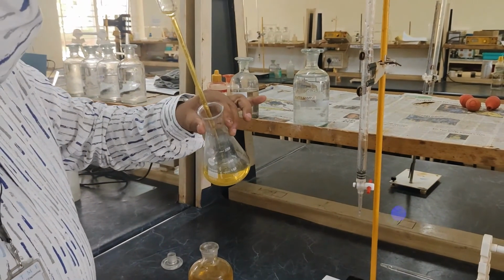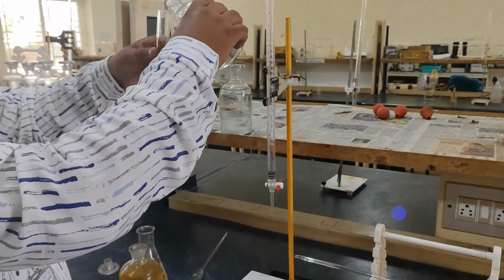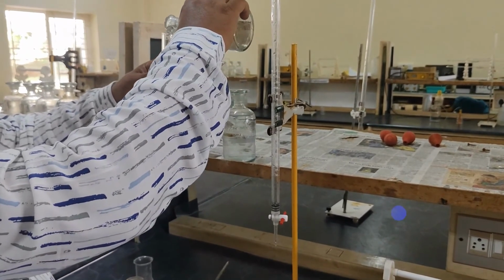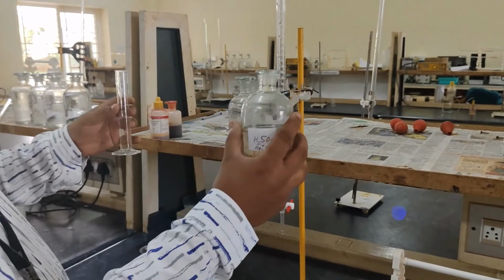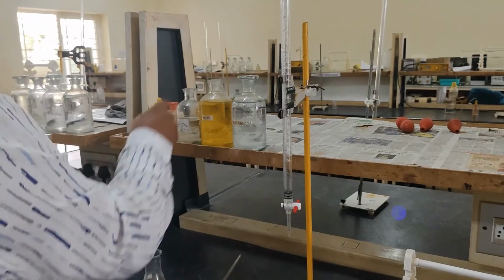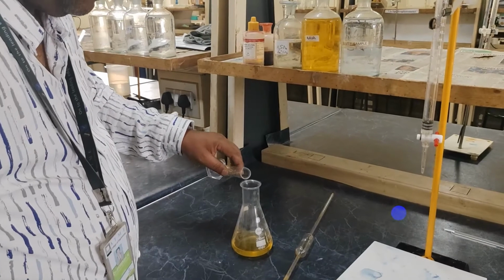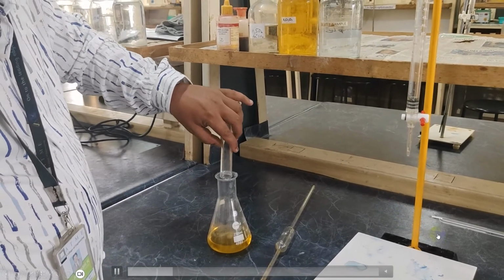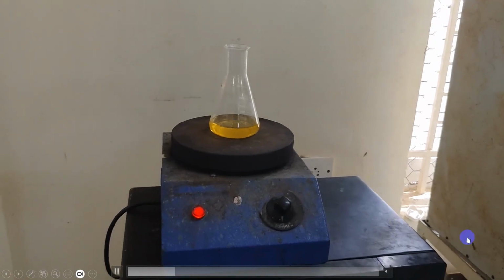If required, you have to take 50 ml of the dichromate solution, depending on the organic compound present. Later, you have to add sulfuric acid and the catalyst silver sulfate. Here we have taken the silver sulfate solution, which is dissolved in sulfuric acid. Around 10 to 15 ml of this catalyst solution will be added into the conical flask, and the conical flask has to be kept for boiling for around 30 minutes.